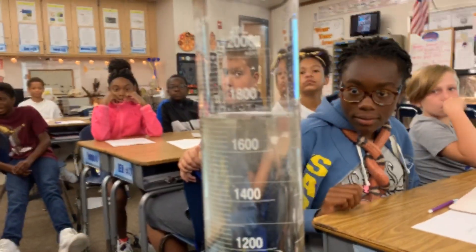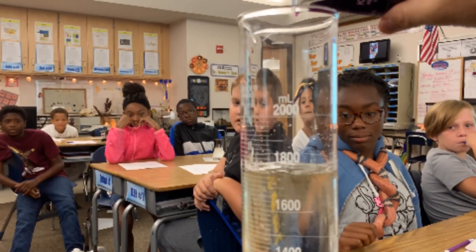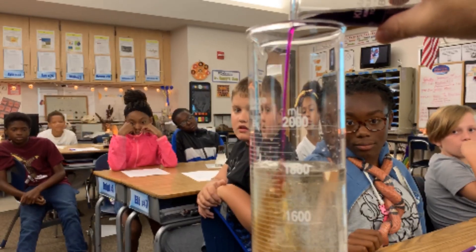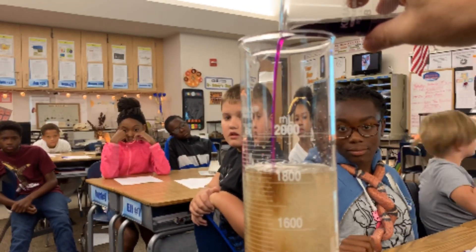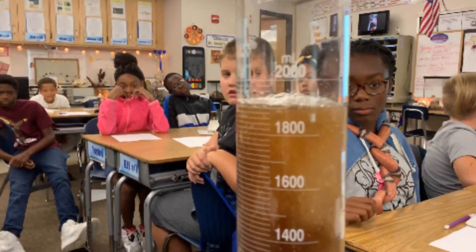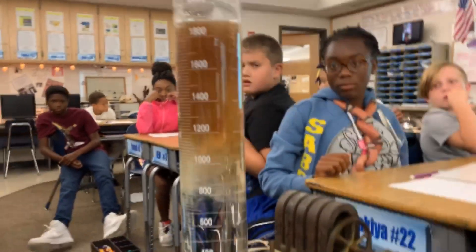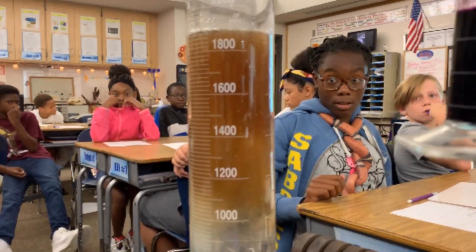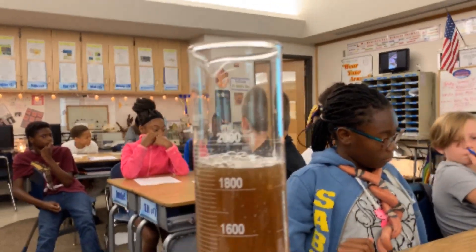Looks pretty clear. Okay, this is a reduction reaction — the potassium permanganate is becoming potassium hydroxide and water. It's giving off oxygen, and of course you have manganese dioxide left. When it gives off that oxygen, those bubbles on the surface, you see a change in color. It goes from this dark purple and if you wait long enough it becomes completely clear again — isn't that amazing?